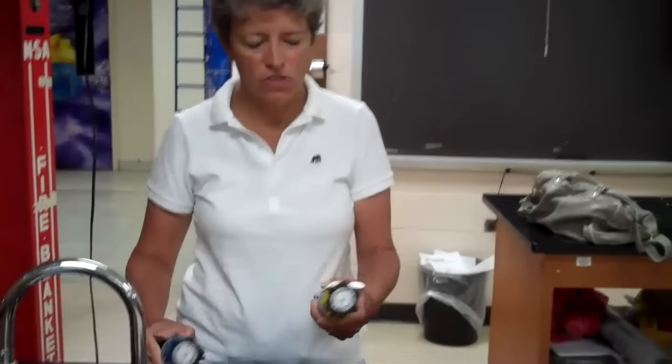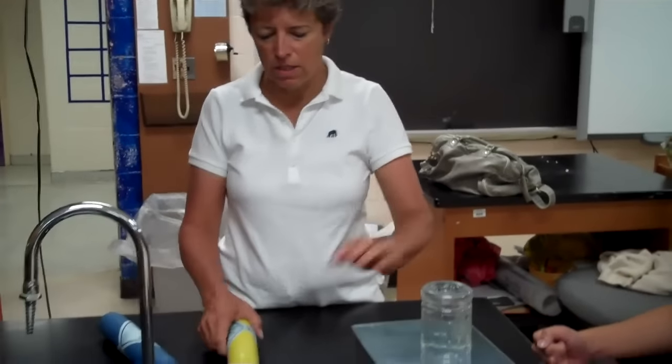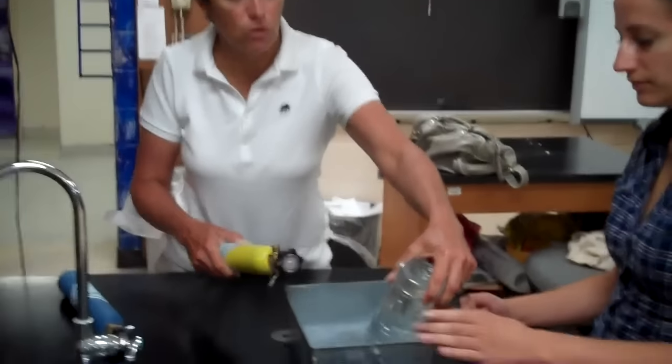They are labeled in their different colors. And because we're going to make water — just a tiny, tiny bit of water — out of the gases that we're putting into the bottle, we want twice as much hydrogen as we want oxygen. H₂O. So you have to hold that up.